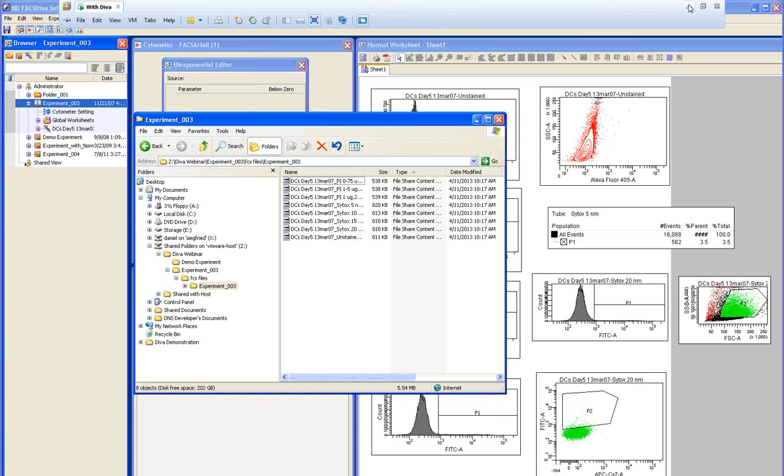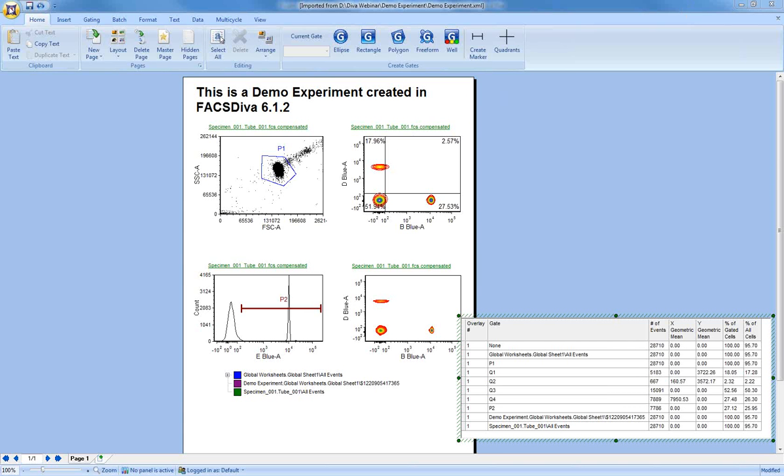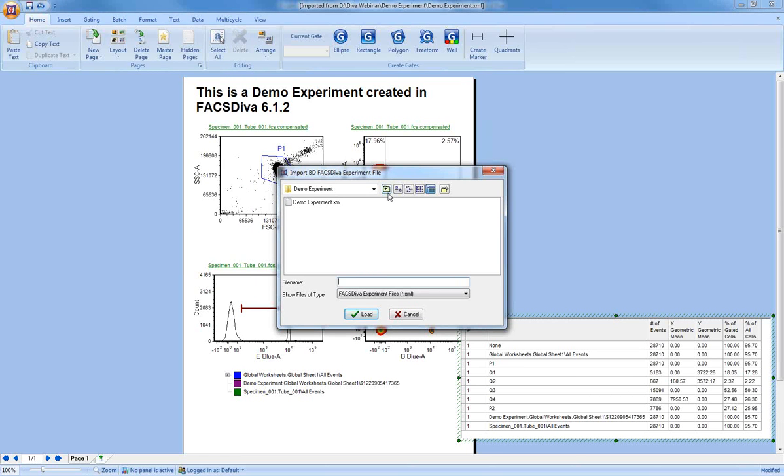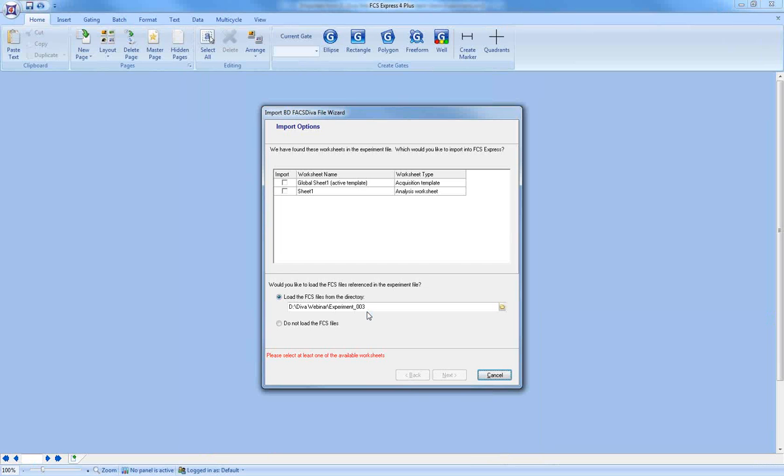Now when I come back into FCS Express, I'm going to import that particular experiment. So import BD FACSDiva file, and we're going to select experiment 3, the experiment 003.xml. This time I have a choice in the import options of which worksheet I want to import. You can actually check both worksheets, but I'm just going to do the second worksheet.